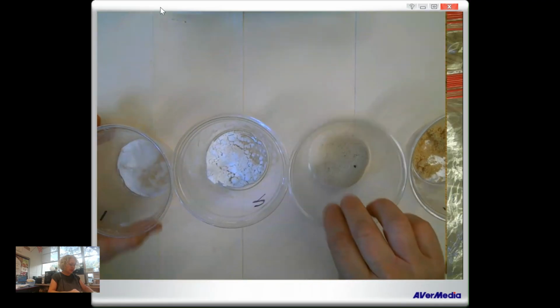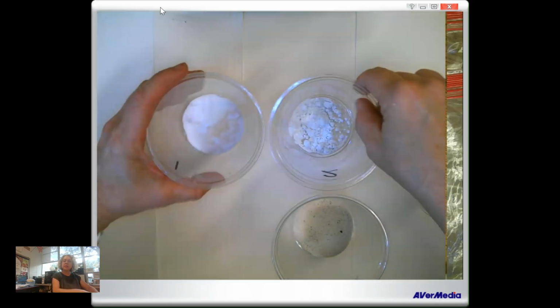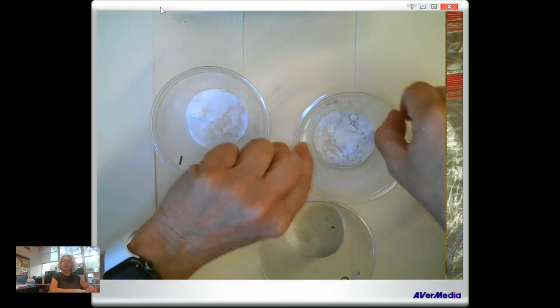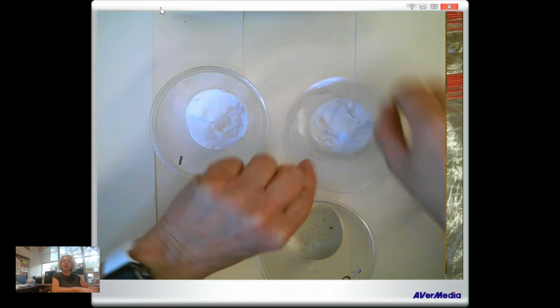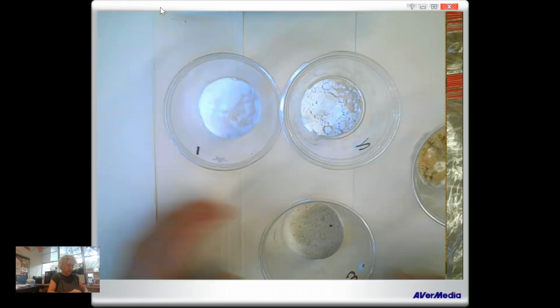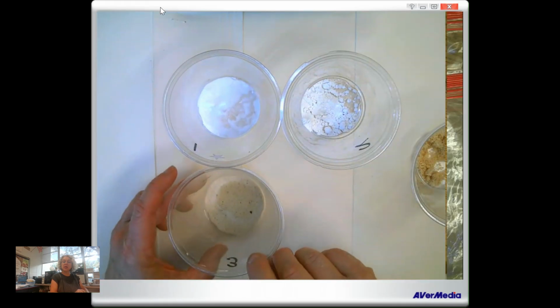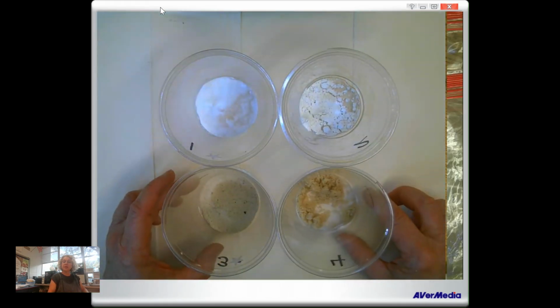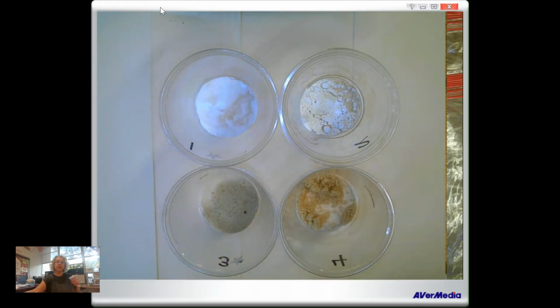Okay. Can all these be seen? Tell you what, I'm going to go 1, 2. Can you see that if I turn it this way? It's going to be backwards anyway. Okay, 1, 2, 3, and 4. You can see the backwards image, right? You're young. You can handle it. Okay, here I go with my first 100.